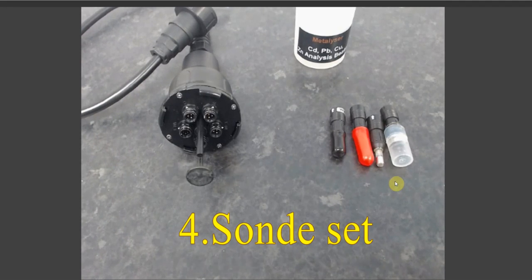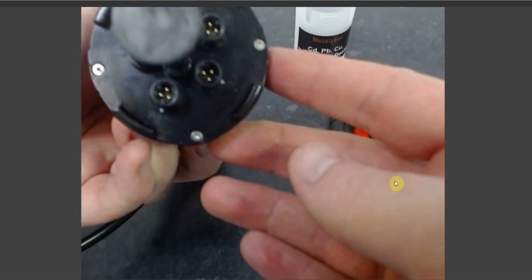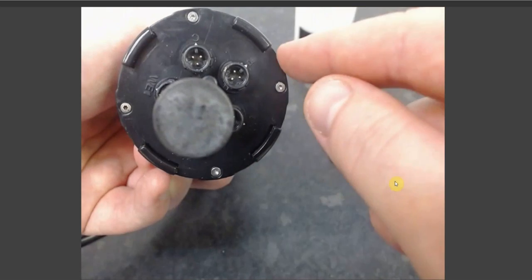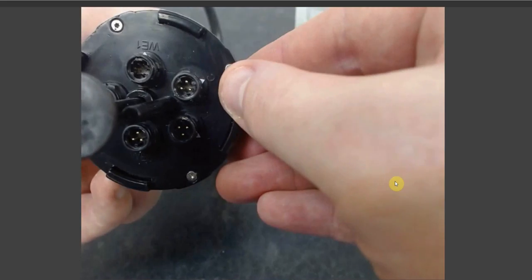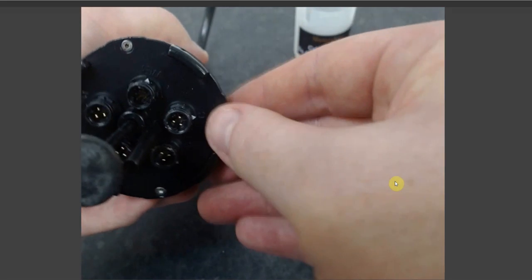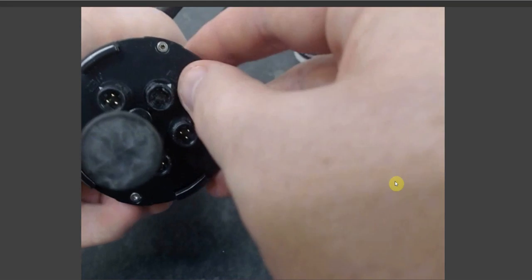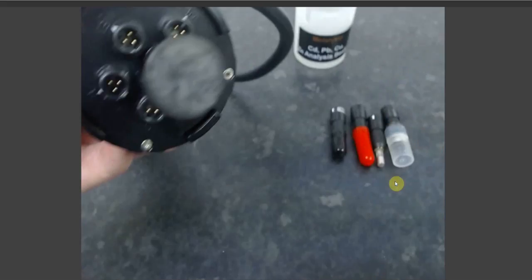This is an introduction to the HM3000 sonde and electrodes, and specifically the setup of both. Taking the sonde, what you can see are 5 different sockets for various electrodes. As you can see, each is labelled. We have an R for your reference electrode, C for your counter electrode, WE1 for your working electrode, WE2 for a working electrode and WE3 for a working electrode.